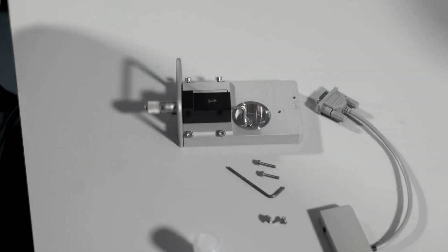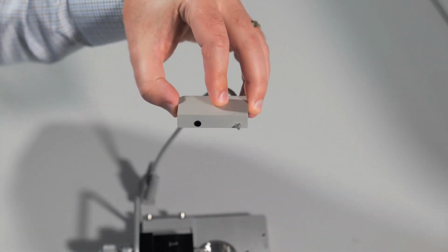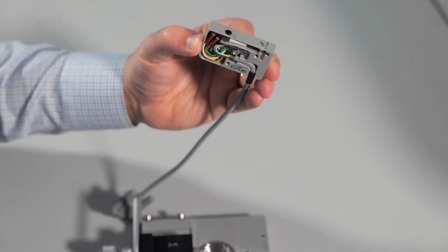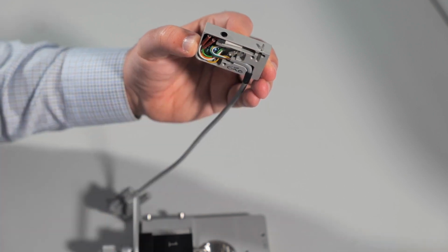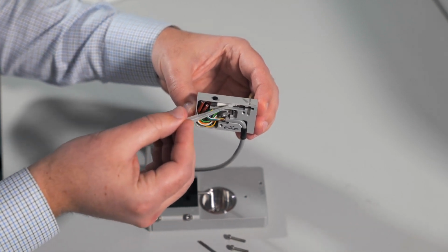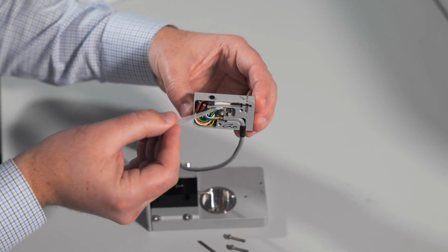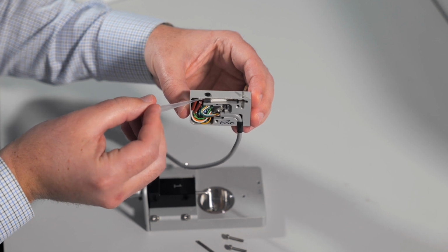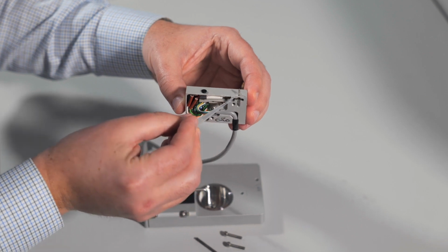To prepare the transducer for the chamber, you want to make sure that it is properly greased. You can see here that this transducer has been greased already, but if it is not, you will take either a pipette tip or a 1 ml syringe and apply some of the clear silicone-based grease around that pinhole. It is also a good idea to add grease along the front edge of the transducer. This will protect against any liquid entering the transducer housing. You can take your pipette tip with grease and apply it along this edge.